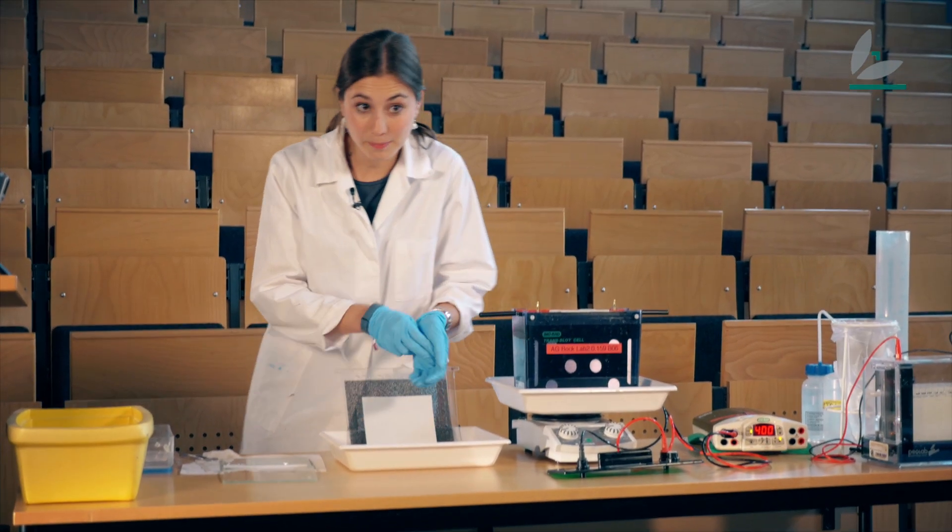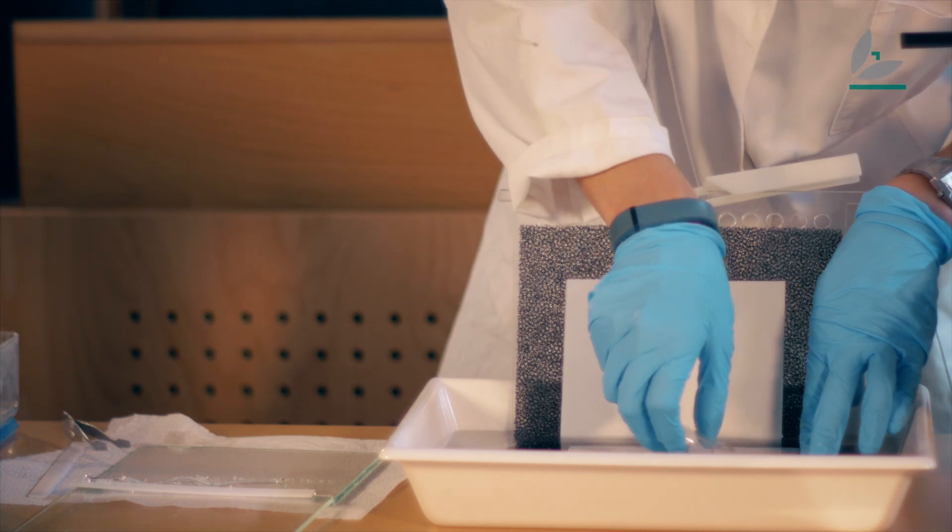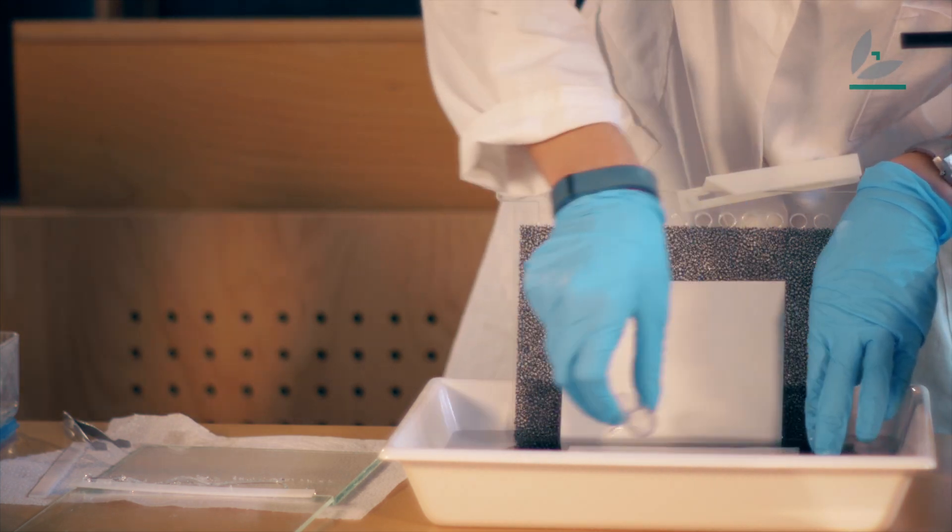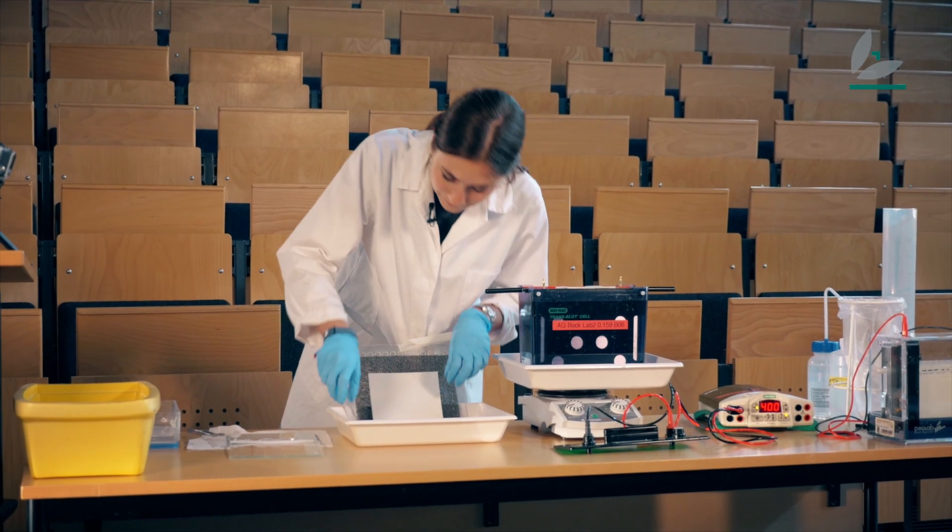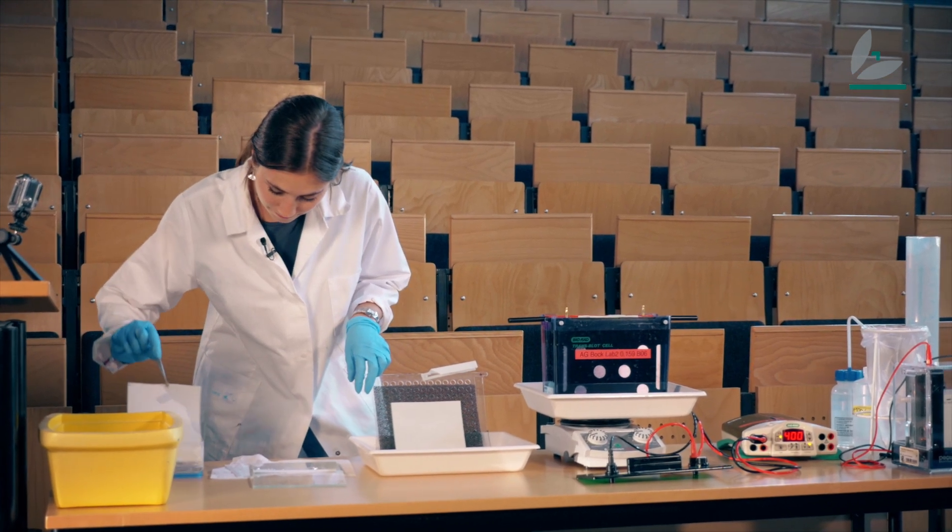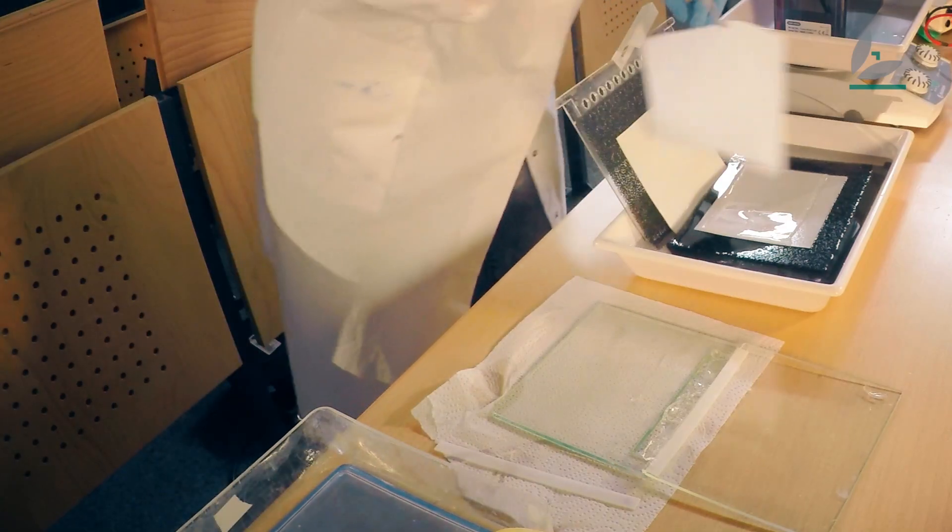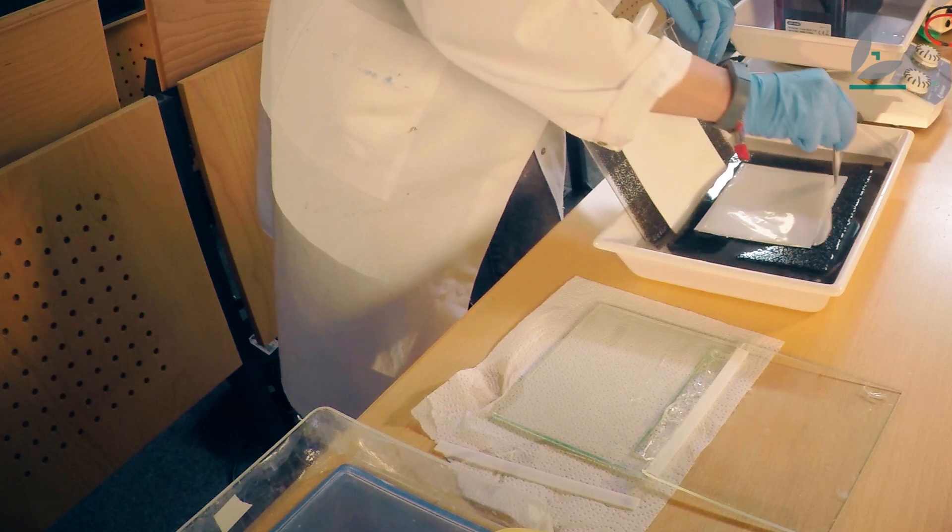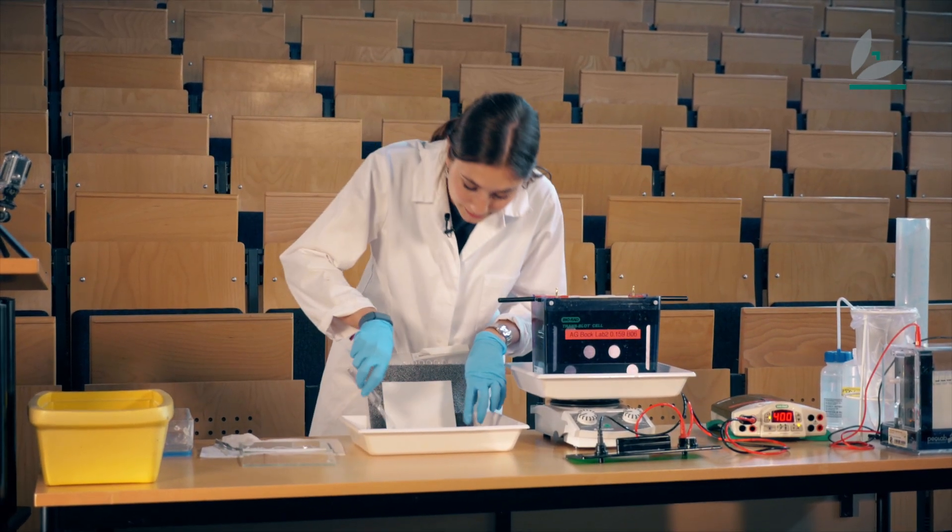Now I don't want any bubbles to stop my transfer of protein, so I'm going to remove them carefully and put the foil on top of it. And again check that there are no bubbles.